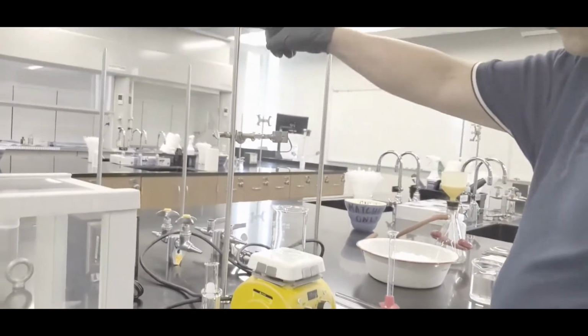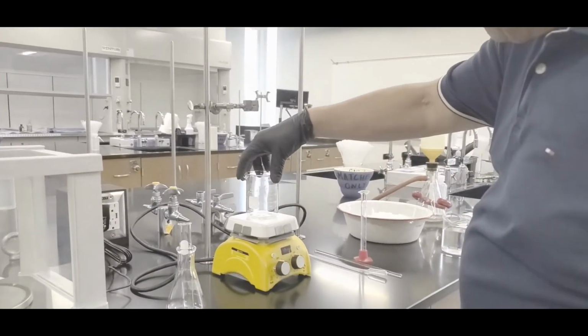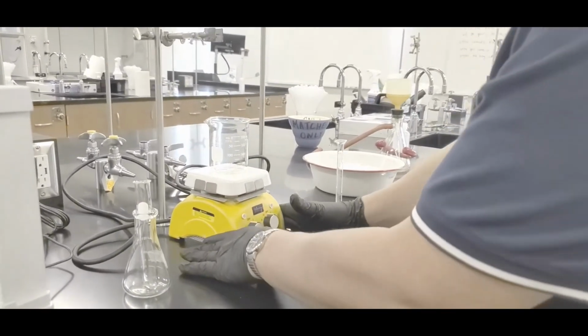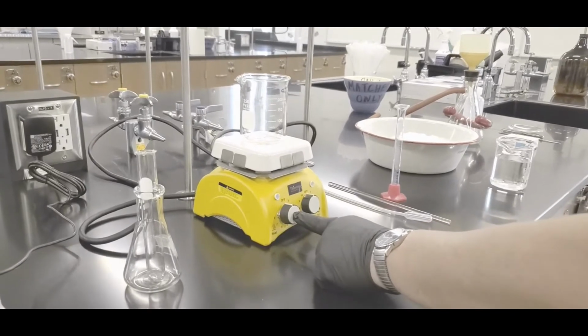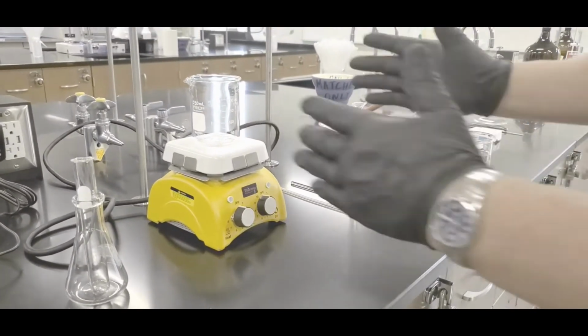What you got here is a pole with a clamp and a 250 milliliter beaker. This is for putting tap water, and there's a hot plate. This is for cooking. Hey, you remember when your handle was down here, never touch the white spot. And of course, the relevant knob is this one right here, the one on the left for heating. Okay, don't play with the other one. All right, so that's cooking.